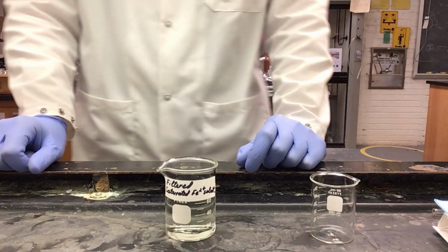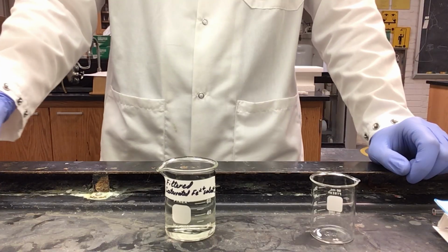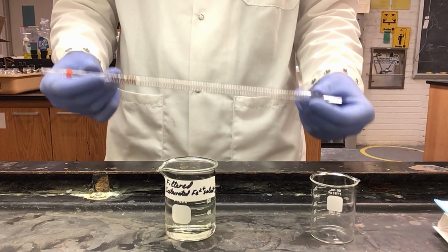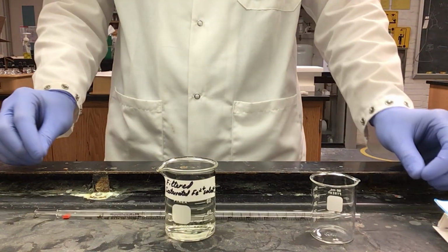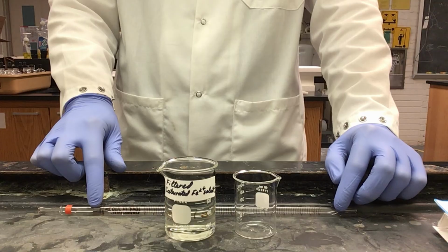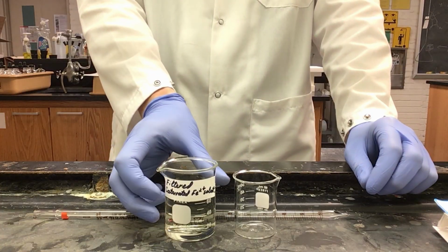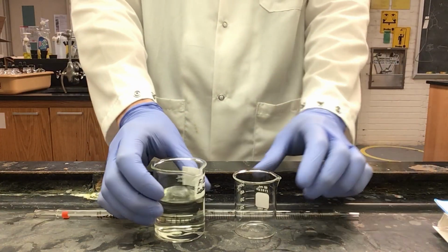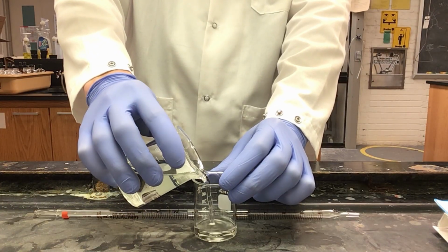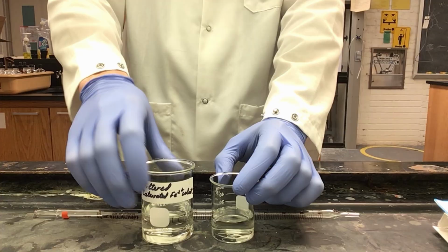Now we are prepping our solution of our saturated iron oxalate. To do this, I'm going to need my 10 ml graduated glass pipette. Since my glass pipette already has some traces of our stock solution from before, I'm going to take a little of my filtered saturated solution and pour it into a separate beaker to use as a rinse beaker.